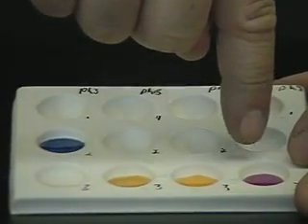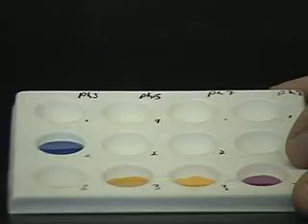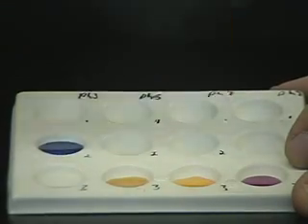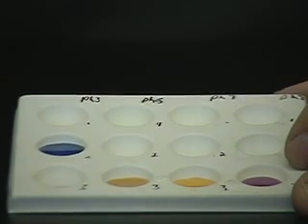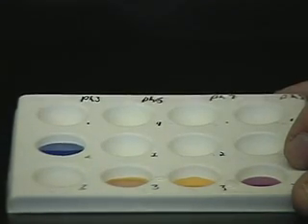Indicator 1 in the presence of unknown acid 1 shows pink. Remember the strong acid also showed pink — therefore unknown acid 1 is stronger than indicator 1. Indicator 2 shows yellow — the strong acid also showed yellow, so unknown acid 1 is stronger than indicator 2. Indicator 3 also shows yellow — the strong acid showed yellow — so unknown acid 1 is stronger than indicator 3. Indicator 4 shows clear — the strong acid also showed clear — therefore unknown acid 1 is stronger than indicator 4.